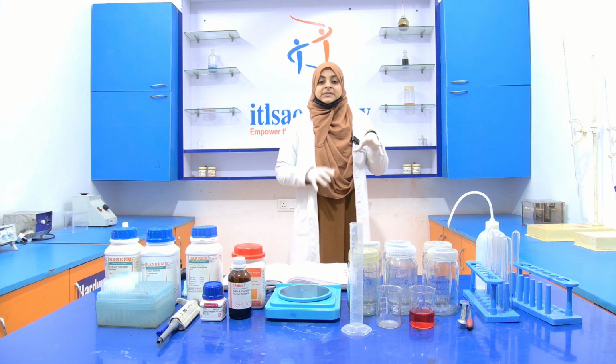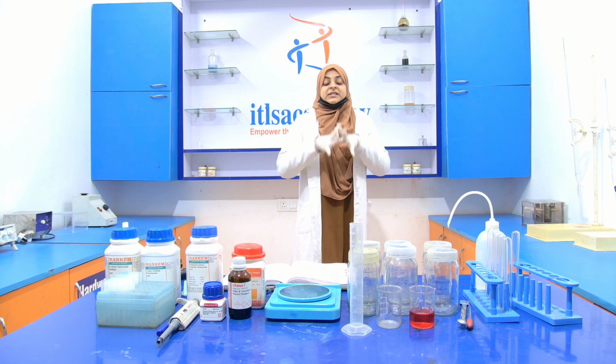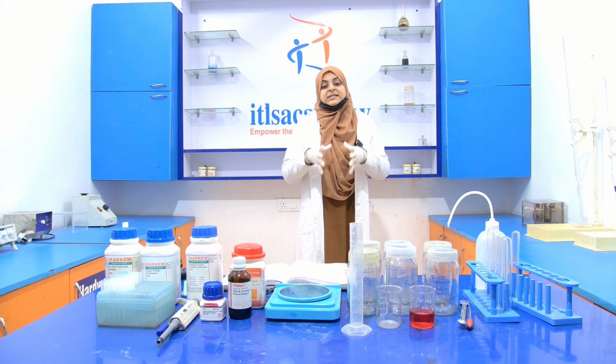So this whole experiment works upon this principle.